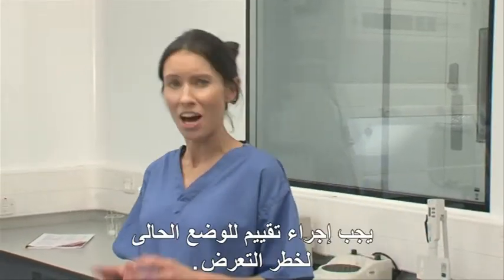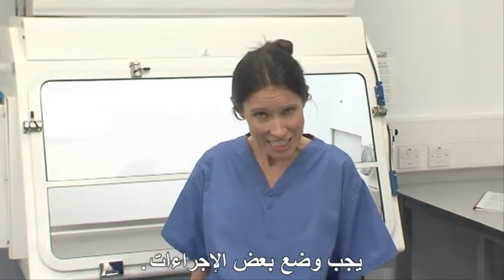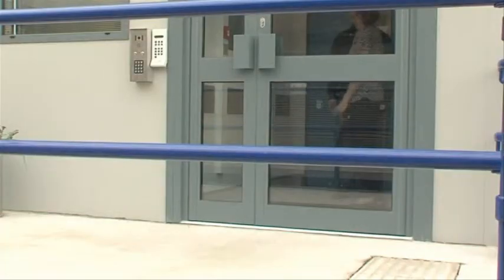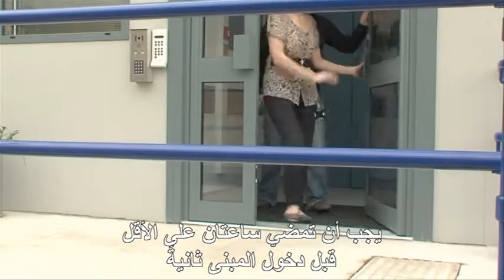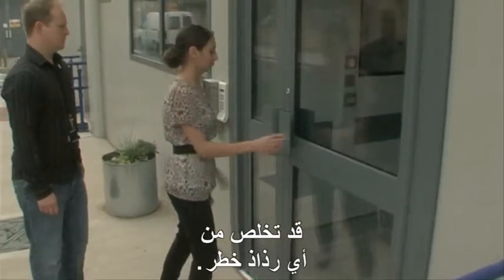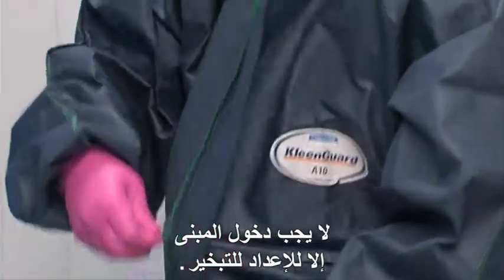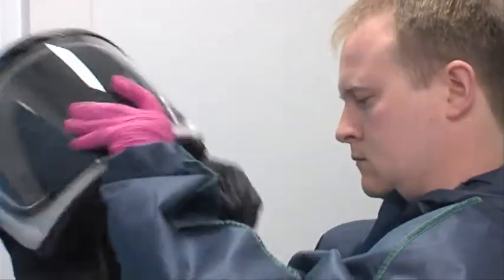Before a thorough clean-up can begin, a local assessment of the exposure risk needs to be made. Once that's completed and approved, certain procedures need to be put in place. At least 2 hours must elapse before re-entering the facility to treat and clean the spill. This 2-hour interval ensures that the air handling system should have removed any hazardous aerosols. The building should only be entered to prepare for fumigation. This must be performed by a designated member of staff wearing full PPE relevant for the category of virus and the task in hand. Then shower out and the affected area fumigated.